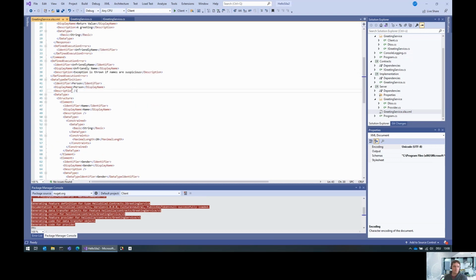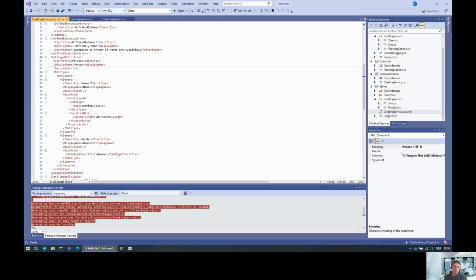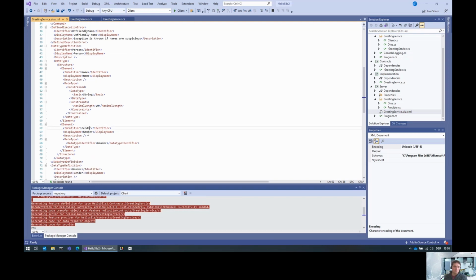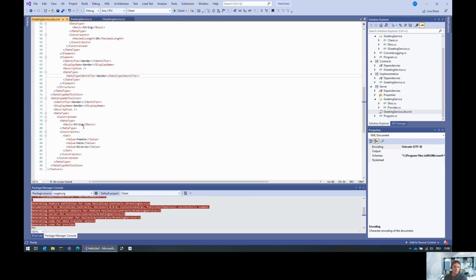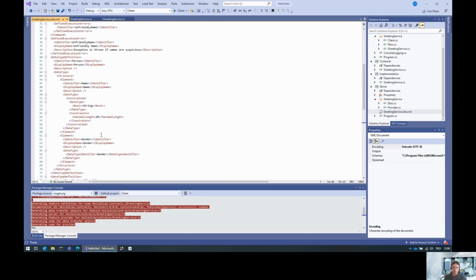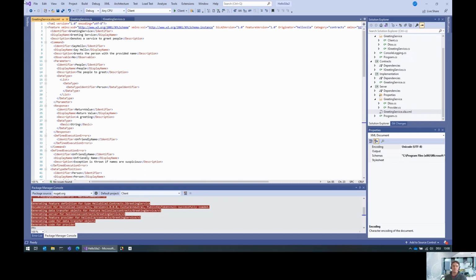It's defined as something that has a name, which is a string with a constraint that the maximum length is 20, as we specified it, and the gender. The gender is of a data type gender, which is basically a string with a constraint that it only allows the values female, male, and diverse. So enumerations are always also directly supported by the SDK.